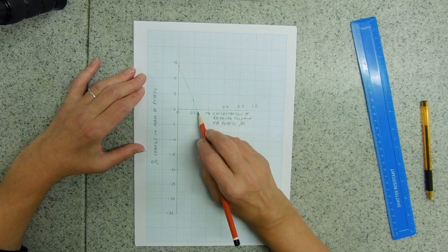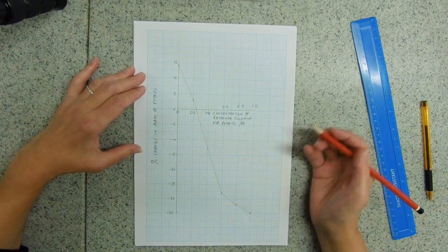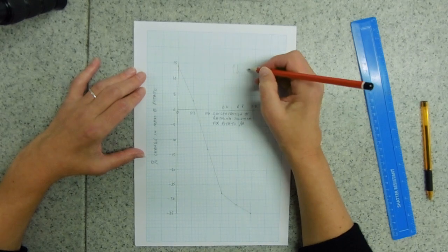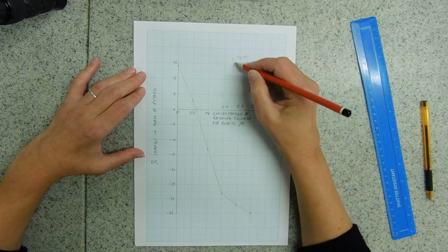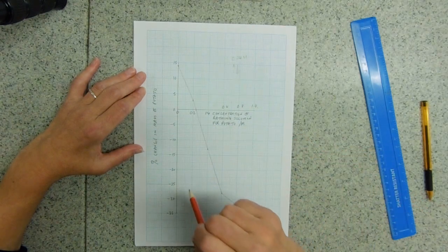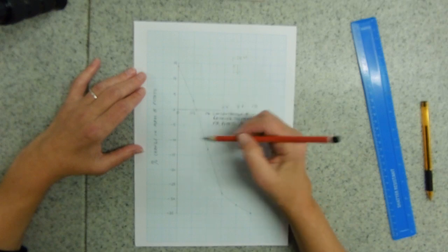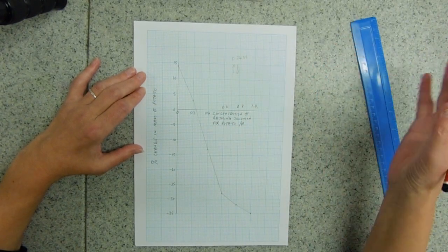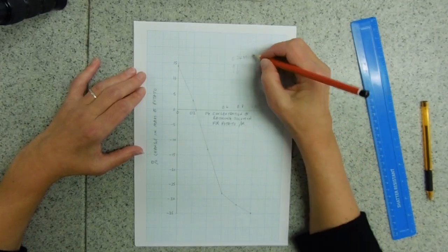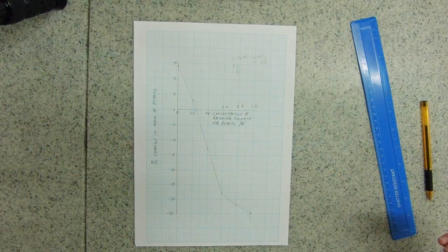We've then got this X intercept here — it's about 0.24 molar — and that's where there is no change in mass. If there's no change in mass, that's where the water is going in and out equally. That 0.24 molar point is where we've got equal movement in and out. The concentration of the solution outside is the same as the concentration of the tissue, and therefore we can work out the water potential — the water potentials are equal inside and outside. We can convert that number to kilopascals, and then we know the water potential of our potato, given all the limitations of the experiment.